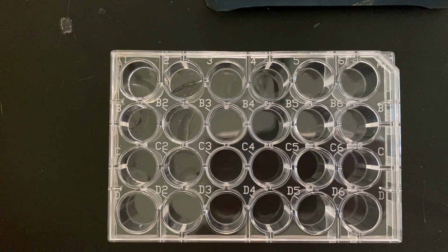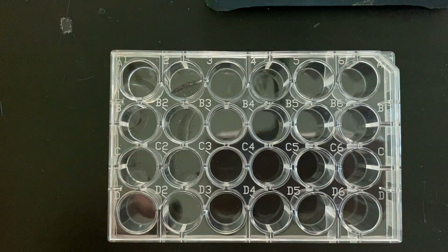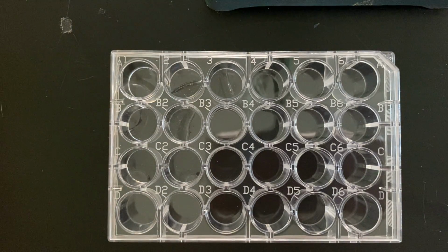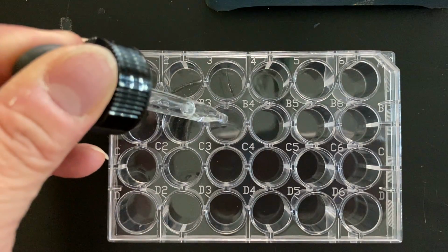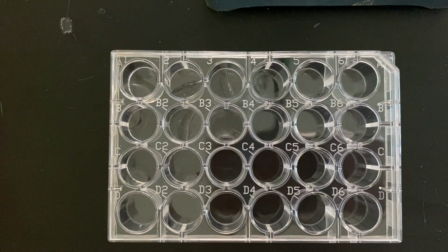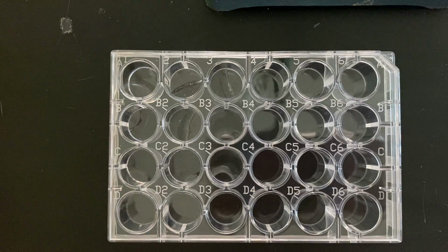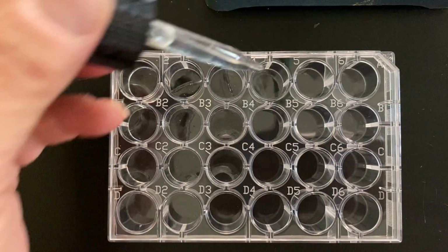It does say 10 drops, being a little stingy. Strontium, there's the strontium. Going in next. And finally barium with the known metals.